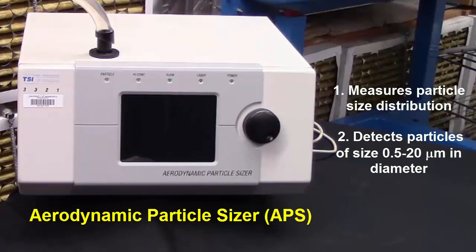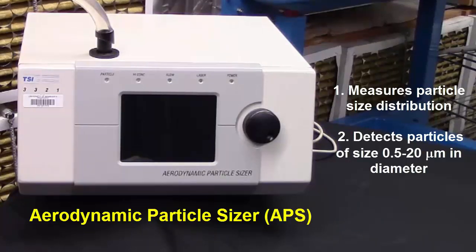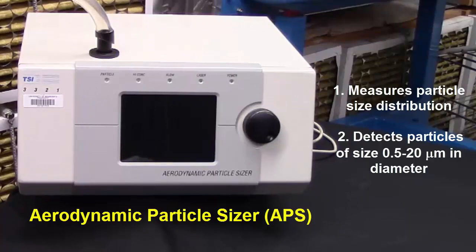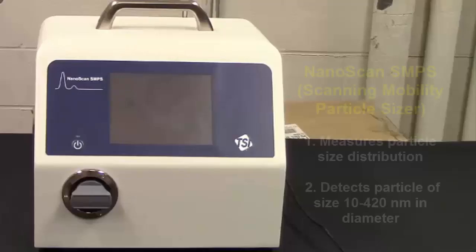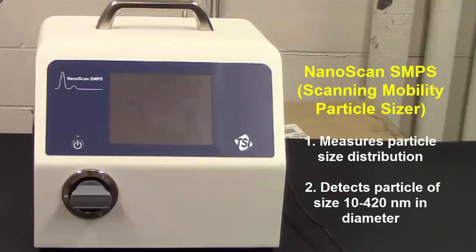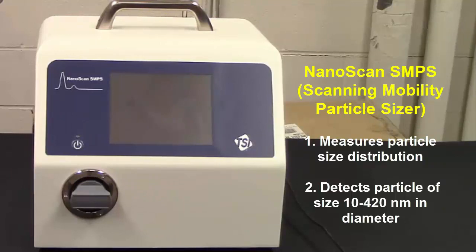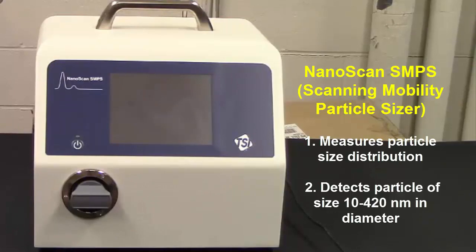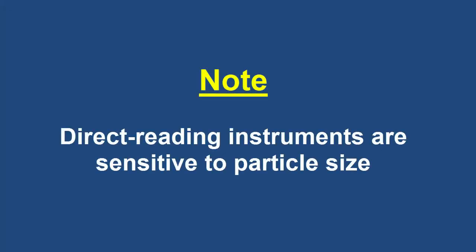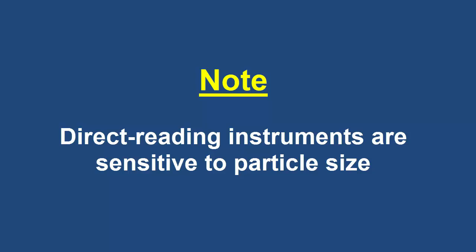Particle size distribution describes the relative amount of particles present in aerosols according to size. The NanoScan SMPS, or scanning mobility particle sizer, also measures particle size distribution like the APS. It measures particle sizes from 10 to 420 nanometers in diameter. In other words, each instrument is sensitive to particle sizes. It is important to note that all the direct reading instruments used for this activity measure particle properties in real time.